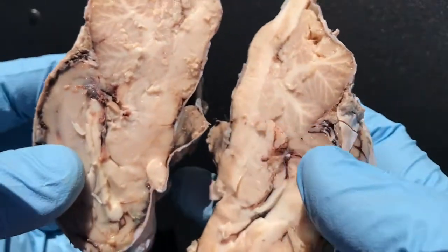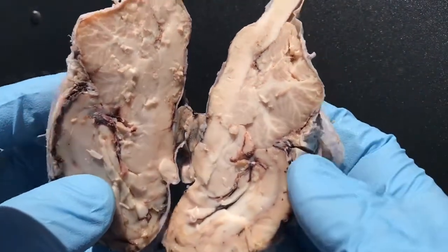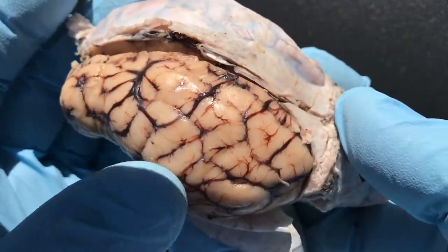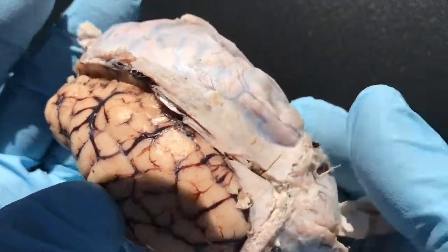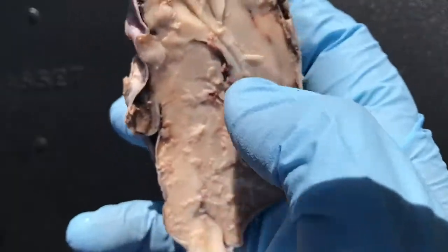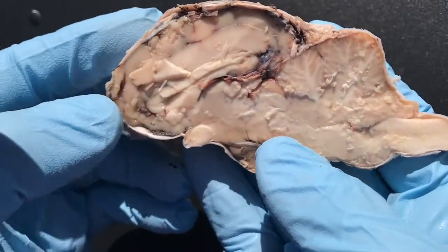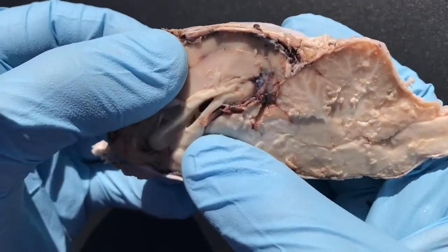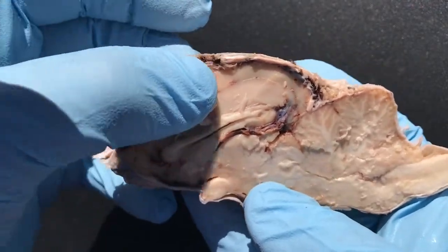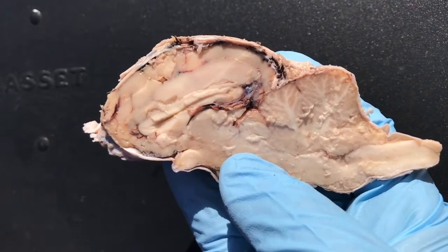Now we have the two cerebral hemispheres. So if we put this back together, this would be the left cerebral hemisphere and this would be the right cerebral hemisphere. We can set one down. And we notice that you have your cerebrum, and this would be the gray matter, the cerebrum.